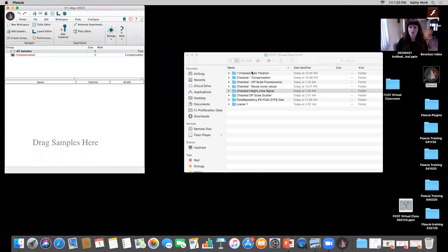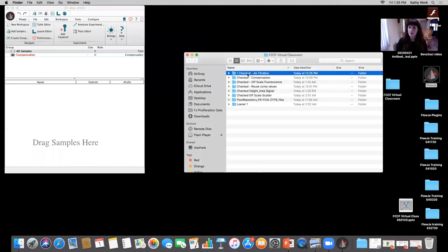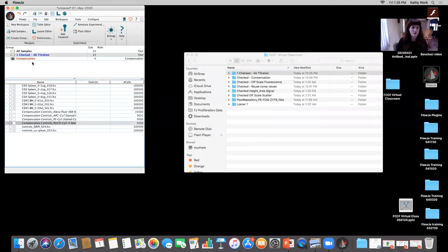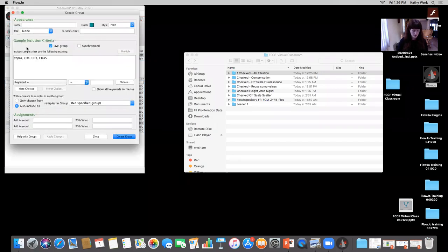Okay, so I have these antibody titration files. I'm going to drag them in. I have the comp controls here, and I have the actual titration samples right here. To make things a little bit easier for myself, what I typically like to do is create a group for each antibody so that everything can be nice and clean and separated. So I'm going to create a group just for CD3.